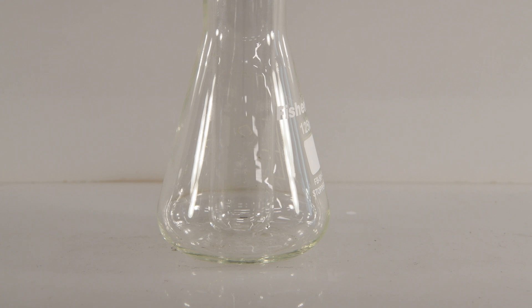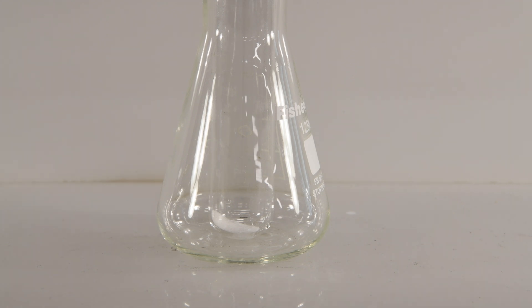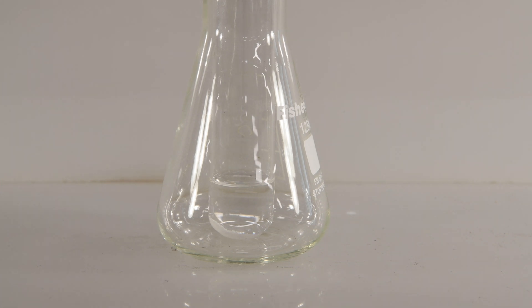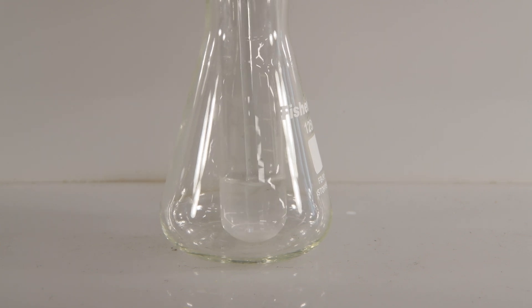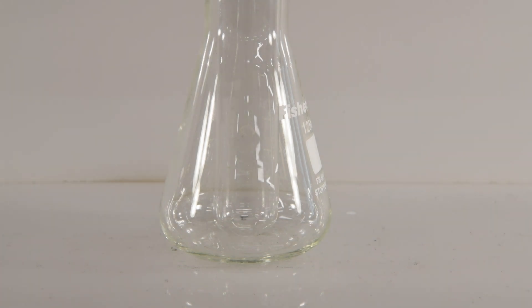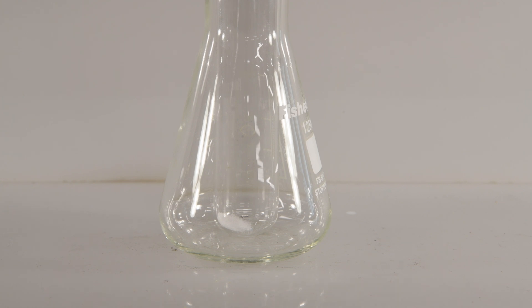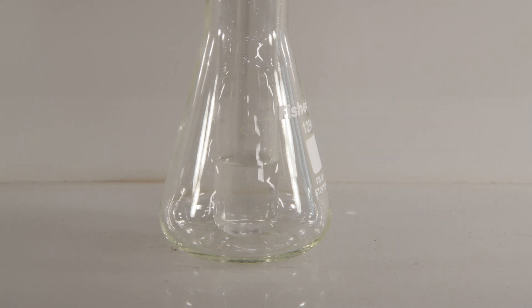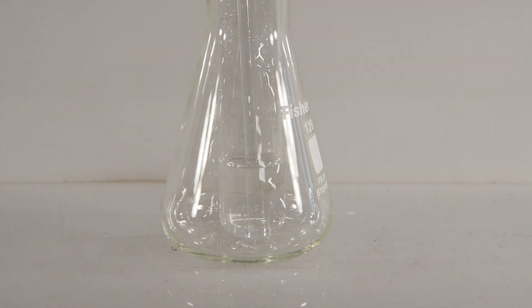Next, we'll try some salt with alcohol. We'll add some alcohol to the salt sample and stir it around. It looks like all of that salt is just sitting unchanged on the bottom of the test tube. Now let's try some salt with water — add some deionized water and stir. I'm sure you're not incredibly surprised that salt dissolves in water; that's probably something you already knew, but now we've confirmed it.